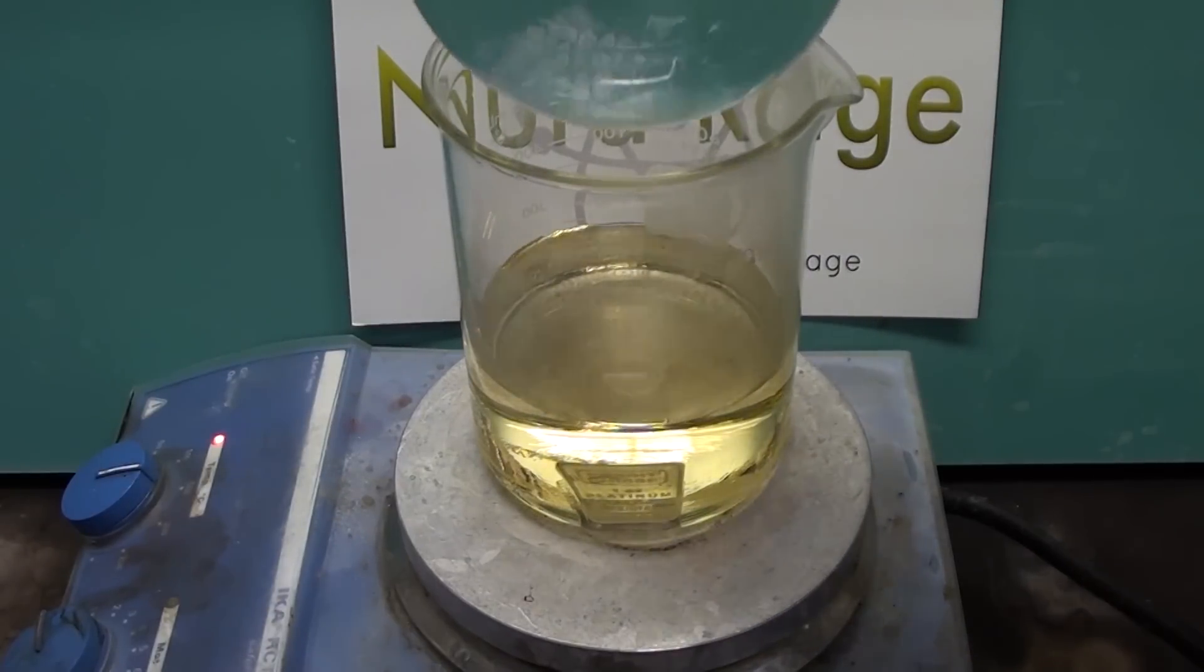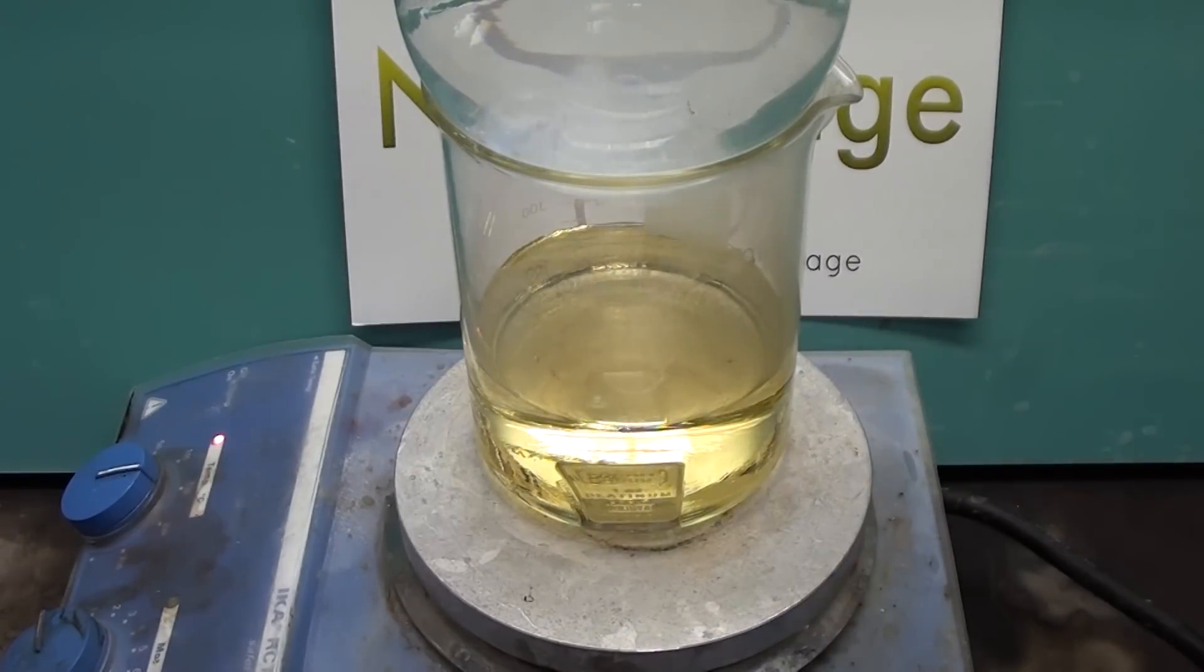I'm putting on top a round bottom flask of cold water to serve as a crude condenser, so we don't lose as much acid due to evaporation.